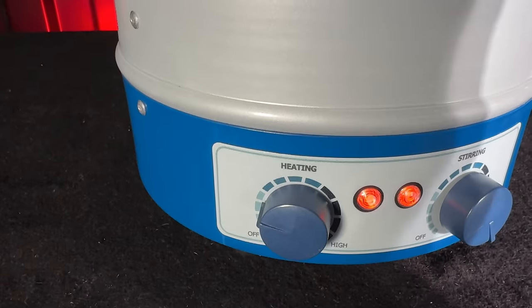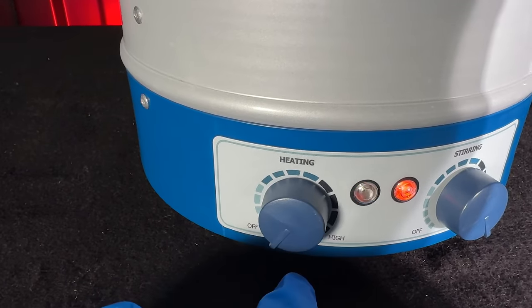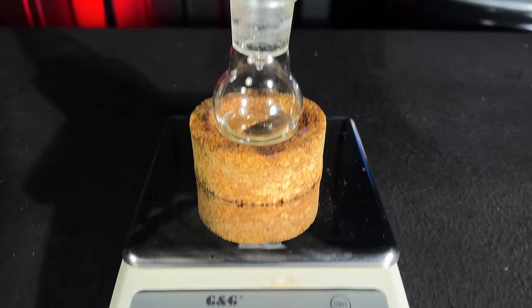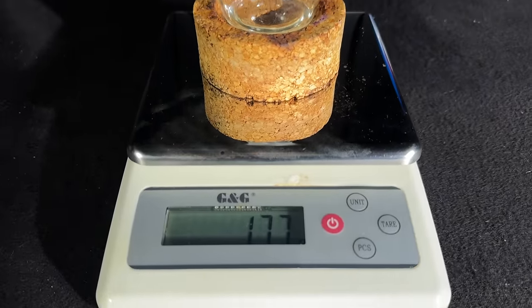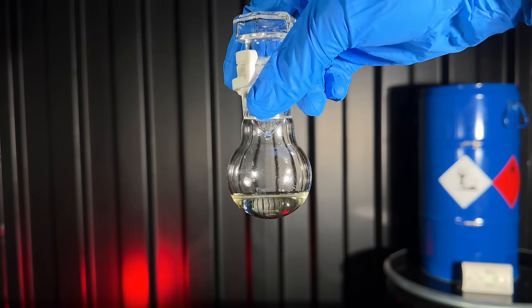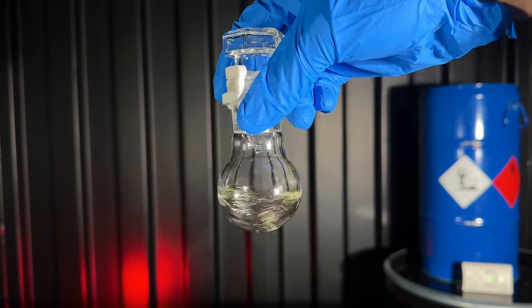The boiling point of the product is 63 degrees Celsius while phosphoryl chloride boils at 106 degrees C. The millisecond the temperature rose above our target, heating was turned off and I weighed out the oxalic chloride. I ended up with 17.7g of product and this represents a yield of 69.8%.